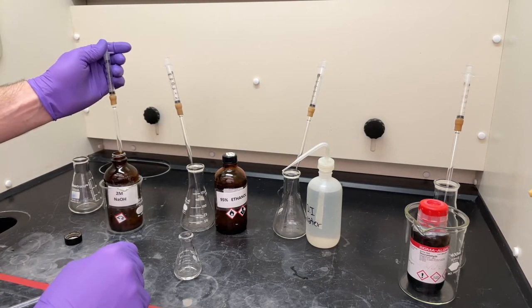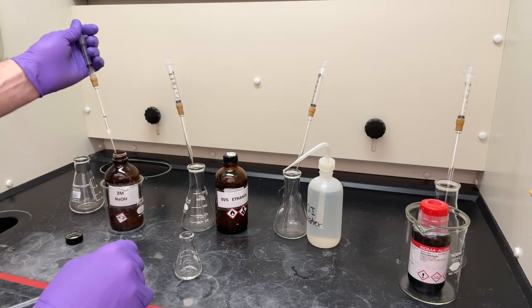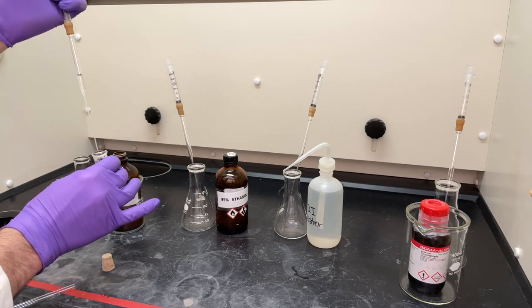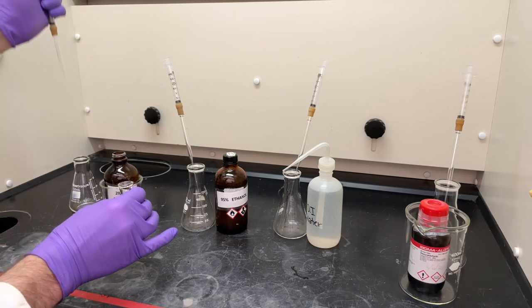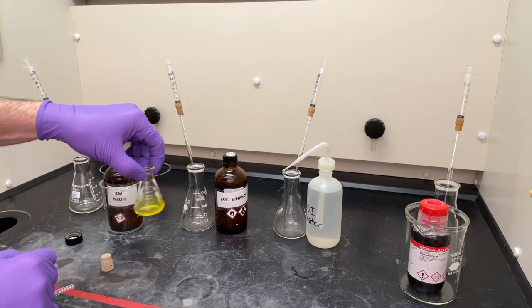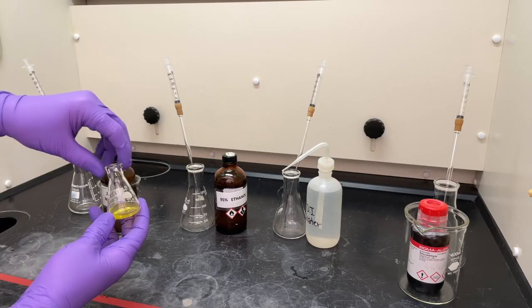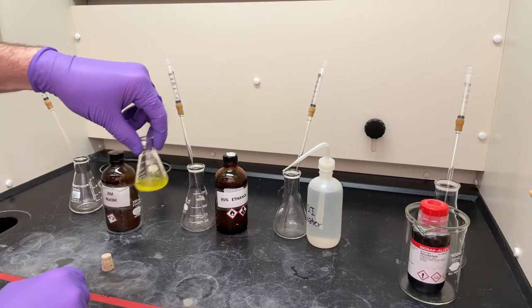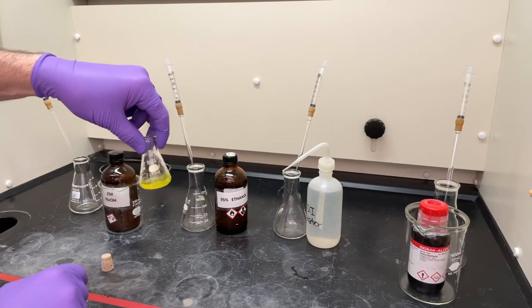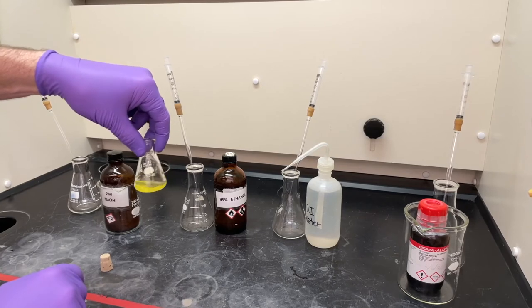Now we're going to add the base — 0.9 milliliters of sodium hydroxide. This is to deprotonate the thiamine hydrochloride and create the active catalyst that is going to react with the benzaldehyde. You'll see a color change — it goes to a fairly bright yellow. That yellow is going to fade. Once it fades, we'll add the benzaldehyde. But before that, we need to get a tare mass on the flask at the balance, then come back and add the benzaldehyde and re-weigh to get the actual mass added.